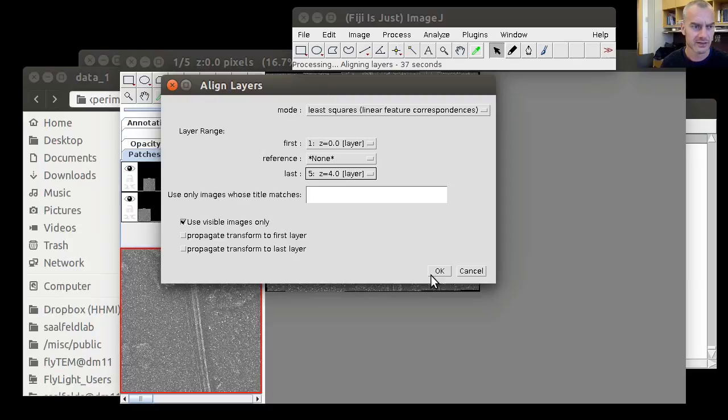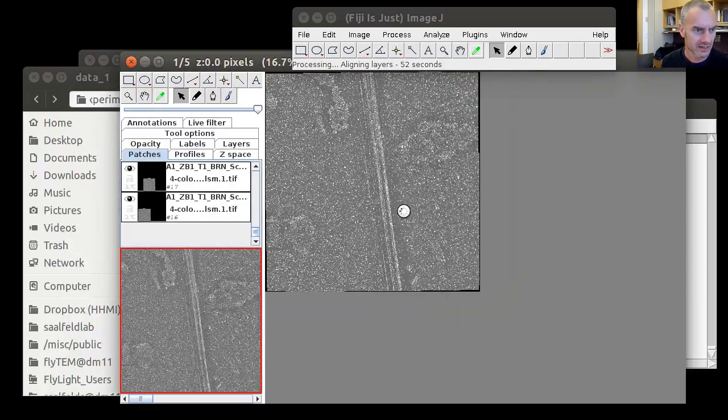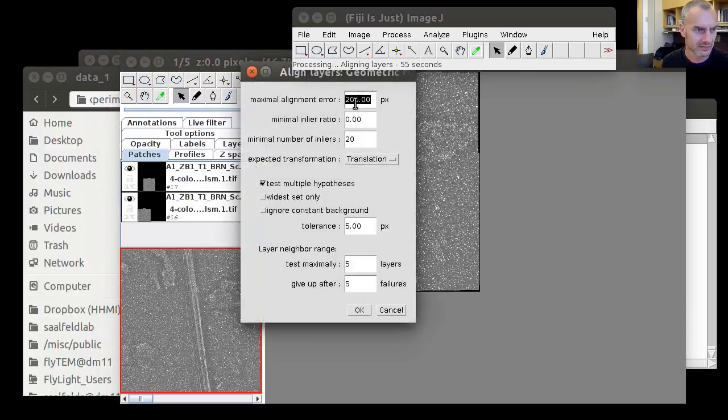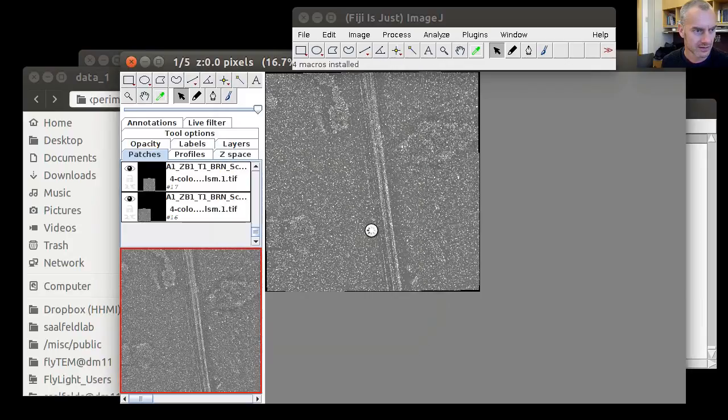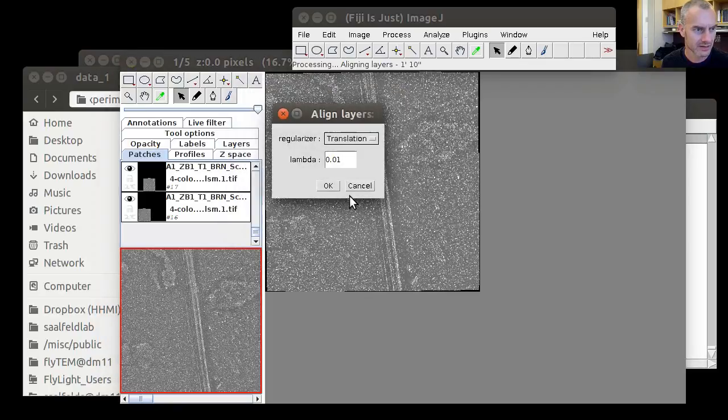And in order to have a lens correction that is consistent across all these multiple channels, we will have to now align them using an affine transformation. We can do that with TrakEM2's layer alignment that we used before. We leave all these parameters as we had them earlier. We leave these as we had them earlier. And the only change that we're doing now is that we want to estimate an affine transform, and regularize it by a translation that goes into the system by a factor of 1%.